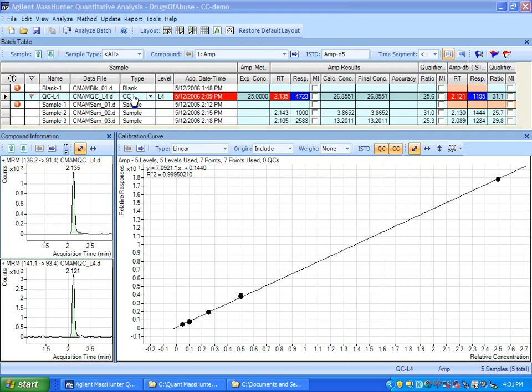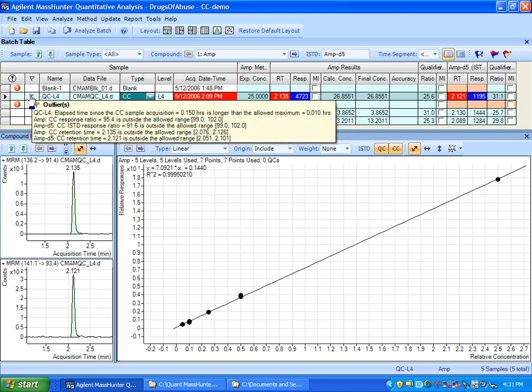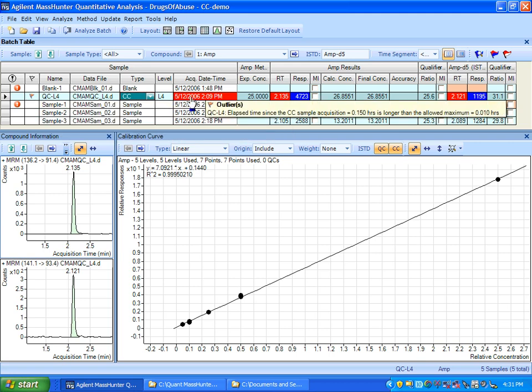Here we are in Batch at a Glance, and let's look at our continuing cal and the outliers. So if we look over here, we can see a list that's been triggered, so let's go through these quickly. The first is, from the time point of view, I'm outside of the time window that's required here for me to run those samples. That's alerting me to that fact. Here's the case where the CC retention time has wandered outside of these, of course, very tight criteria. Here is the CC response ratio, which again has fallen outside of that limits, the ISTD retention time, and last, the ISTD response ratio has fallen out.